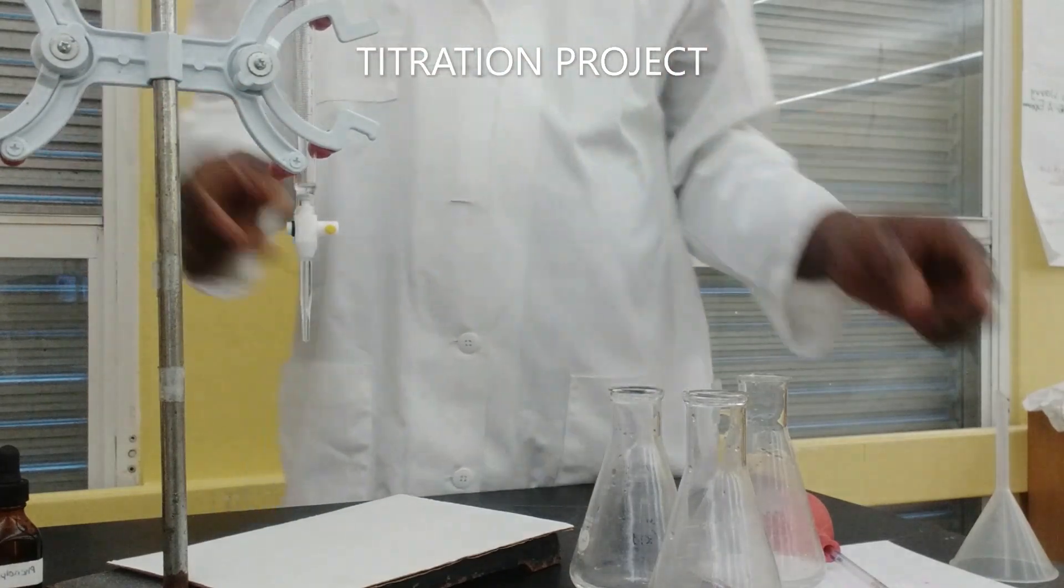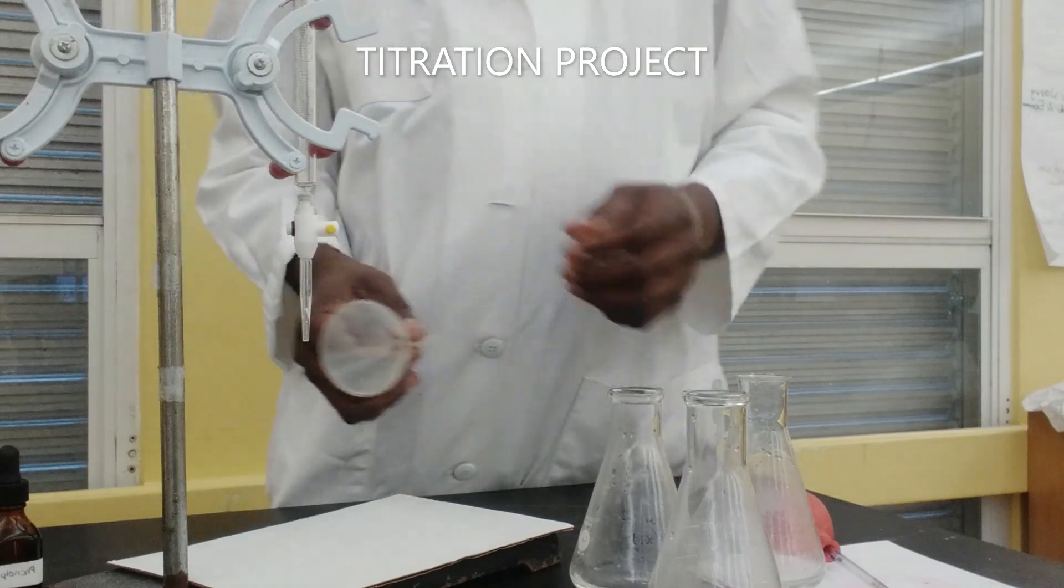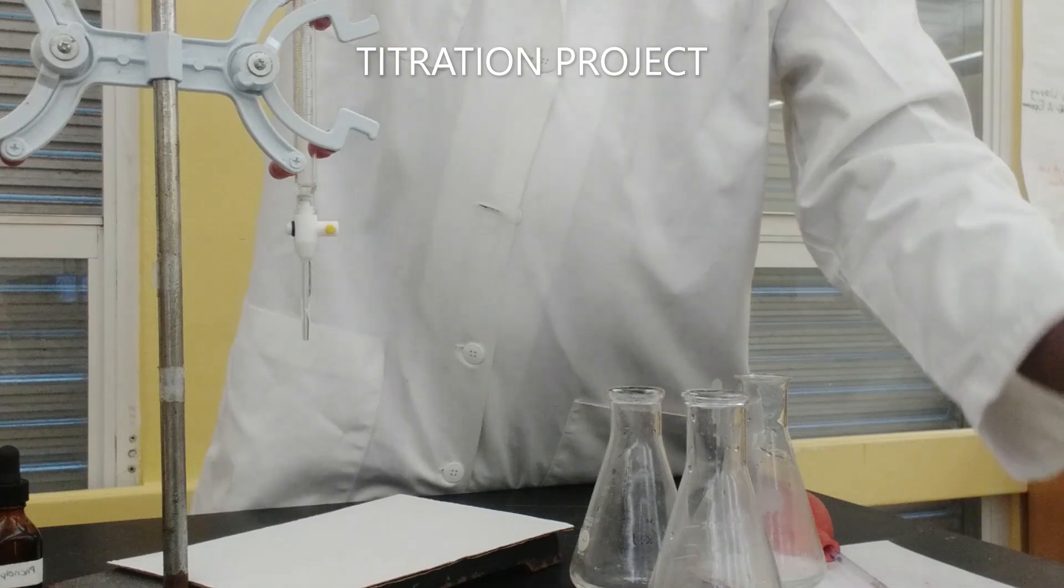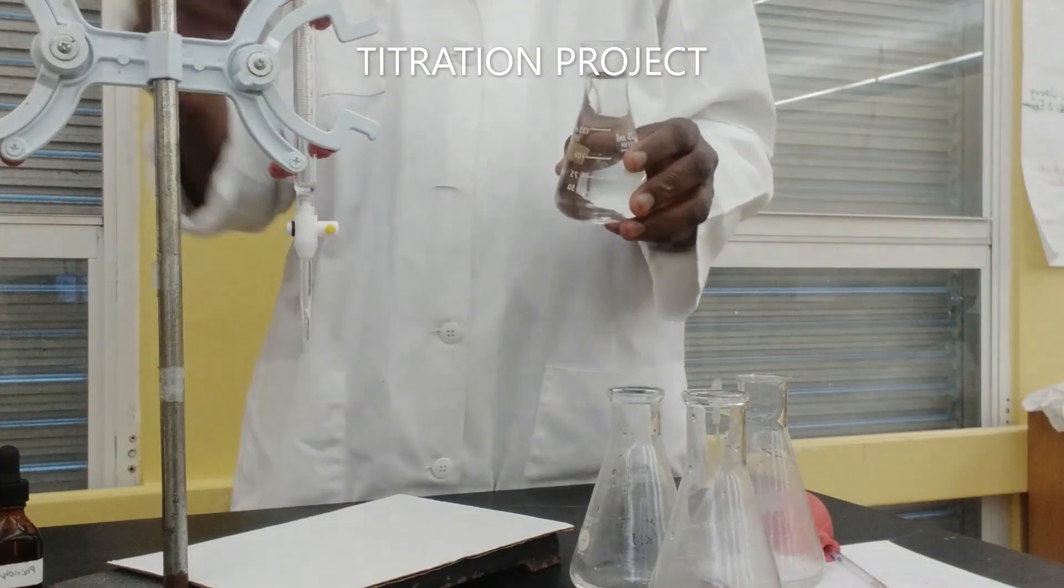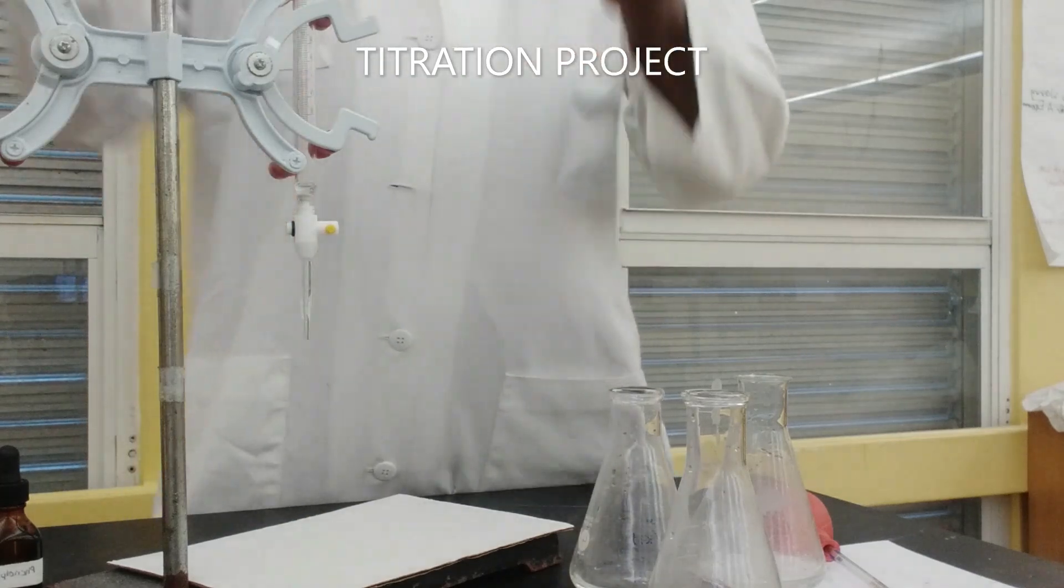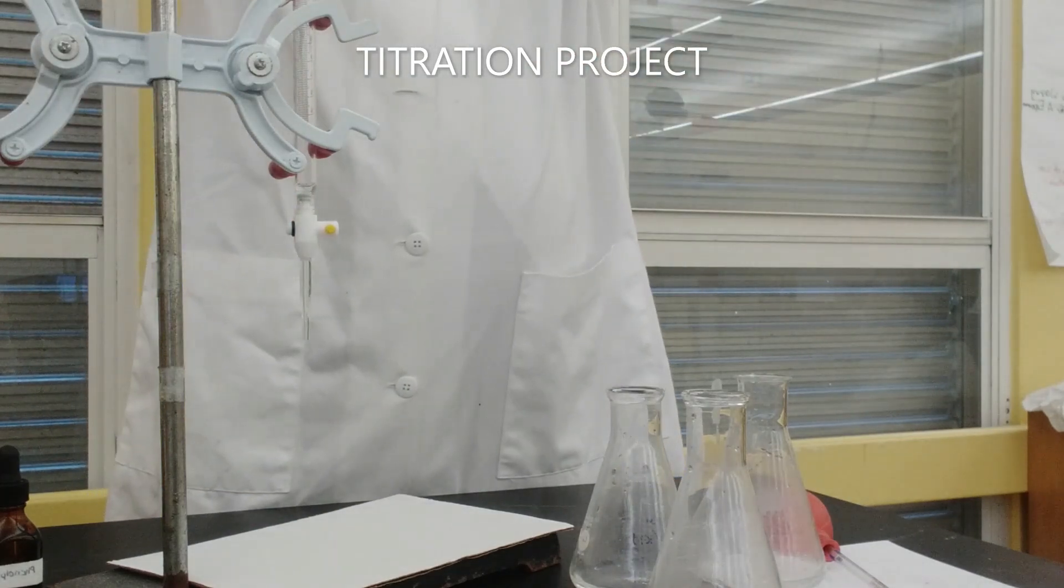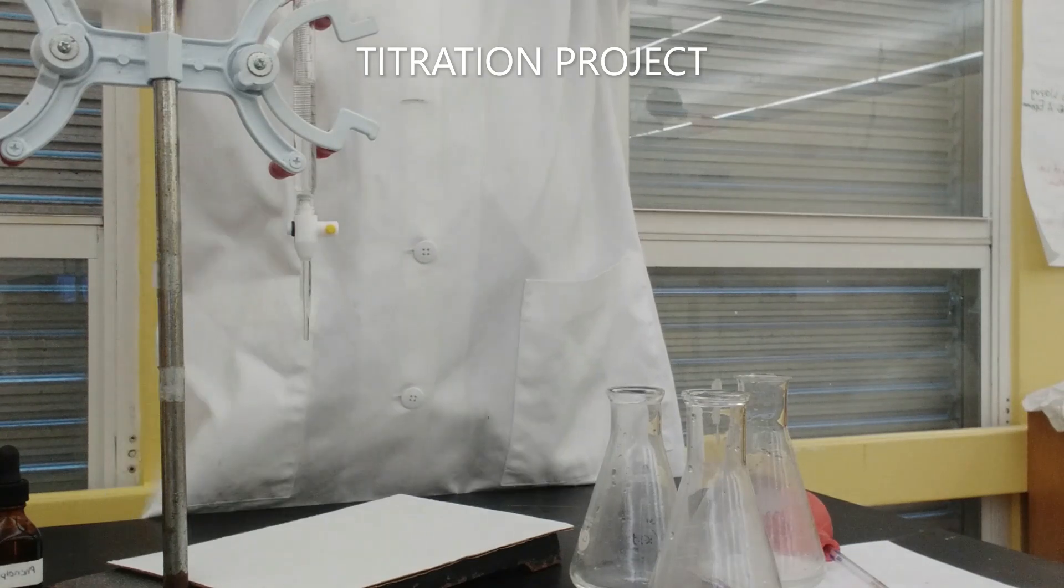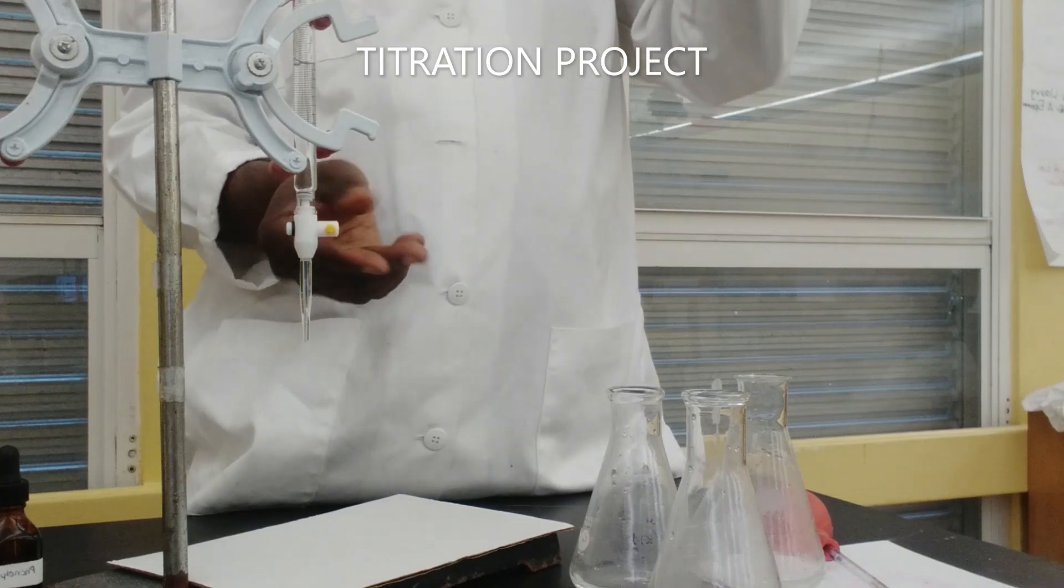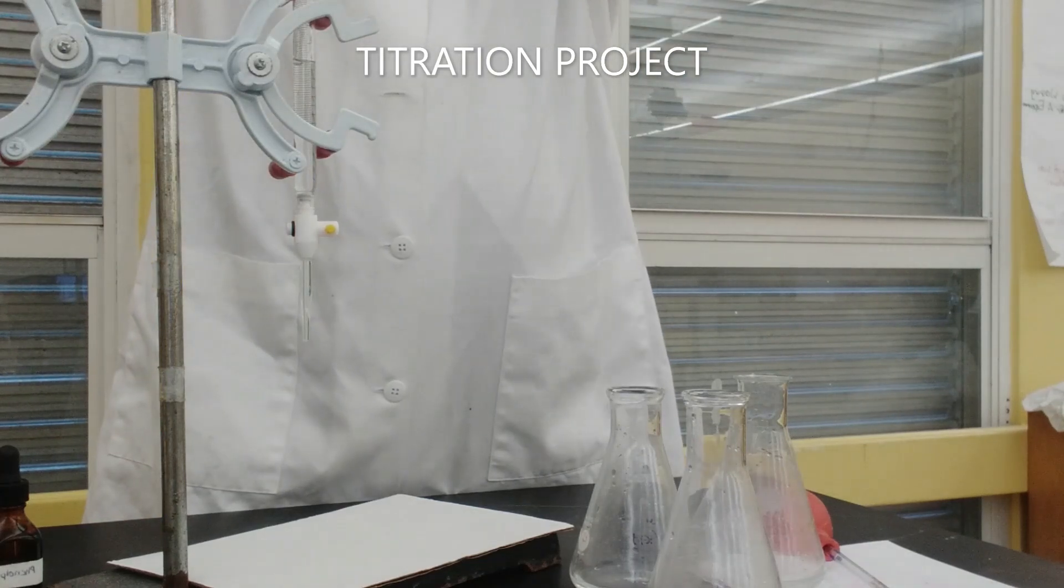I'm going to use the funnel to help me in making sure that I don't spill the base as I transfer it into the burette. When you're doing this, you want to ensure that your burette tap is locked, so that way you don't make a mess.